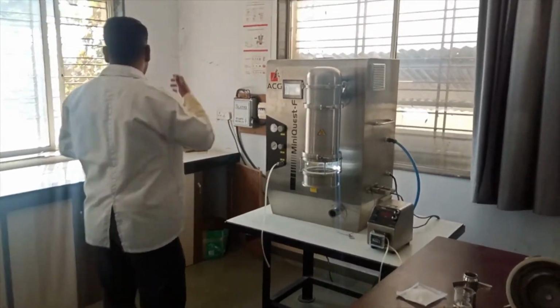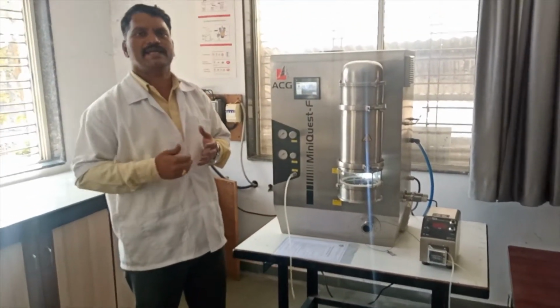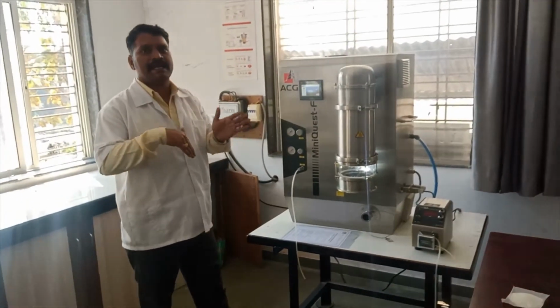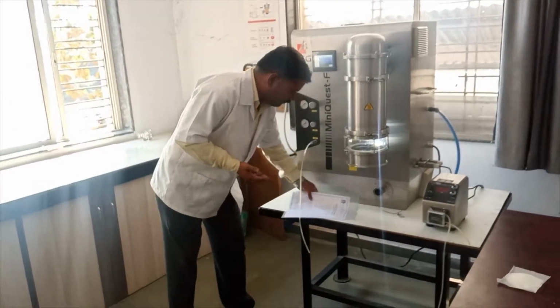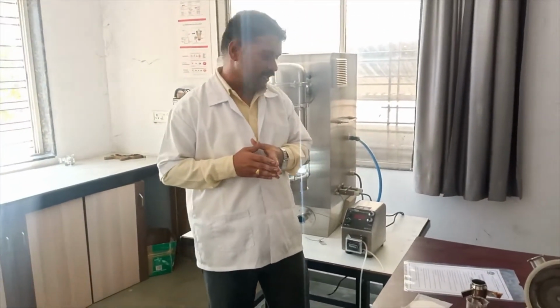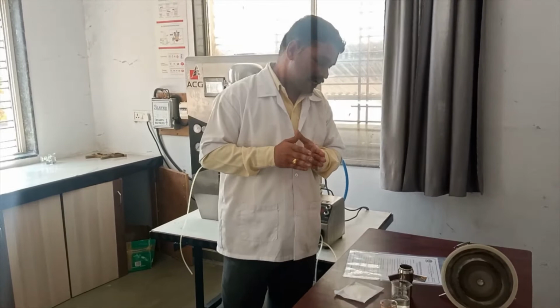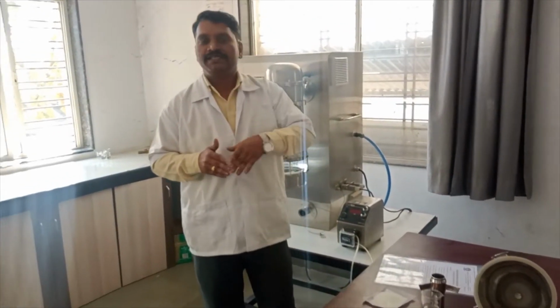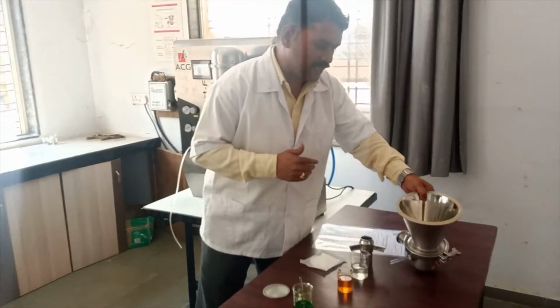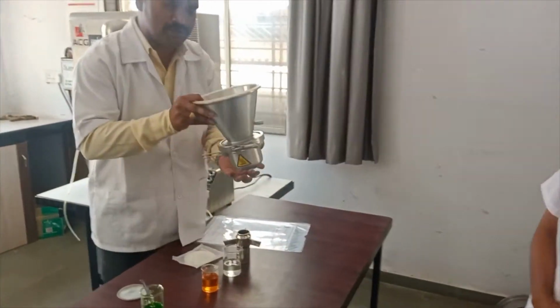Before starting the actual process, see the standard operating procedure, the SOP for using this fluidized bed processor, before the process and after the process. Let's see the steps one by one. The first step is to open the tri-clamp closure at the material container. Then hold the material container along with the bottom part and open the tri-clamp closure at the processor inlet. Charging the material into the chamber is very important, as is the adjustment of the gun and nozzle at the nozzle point.